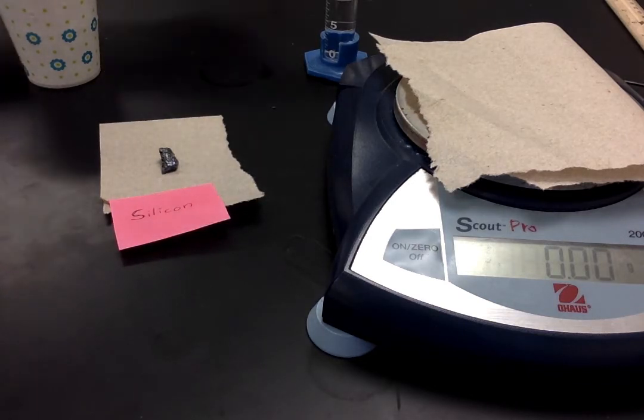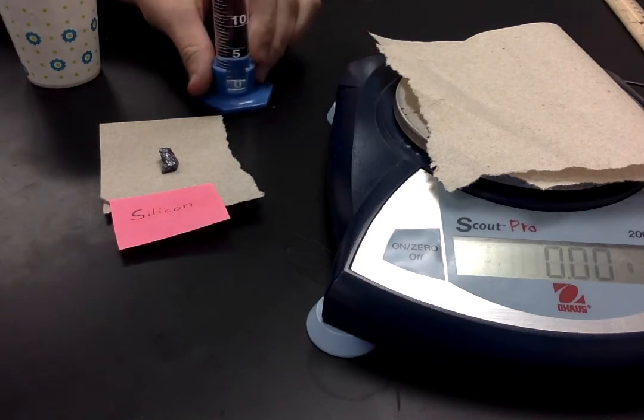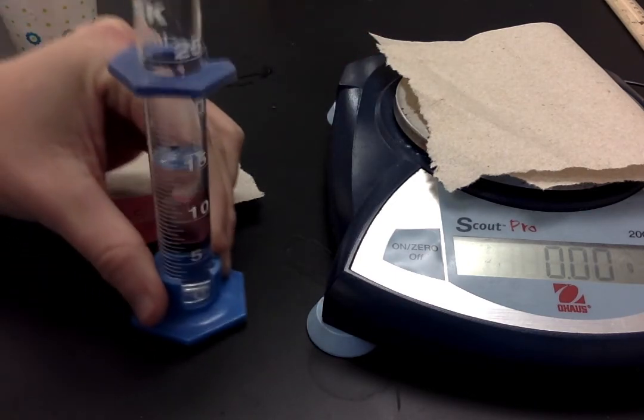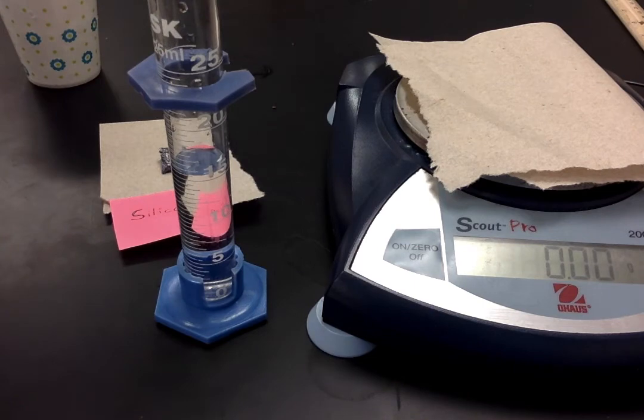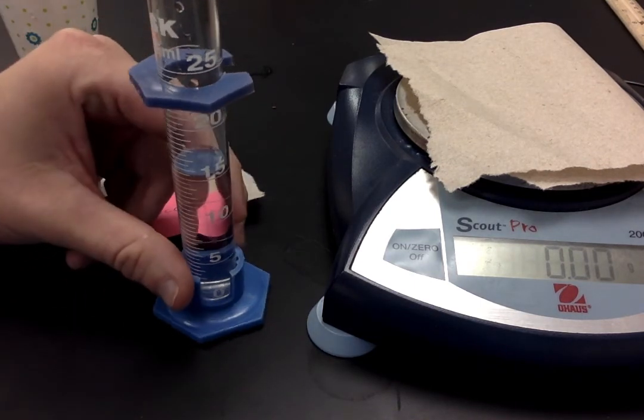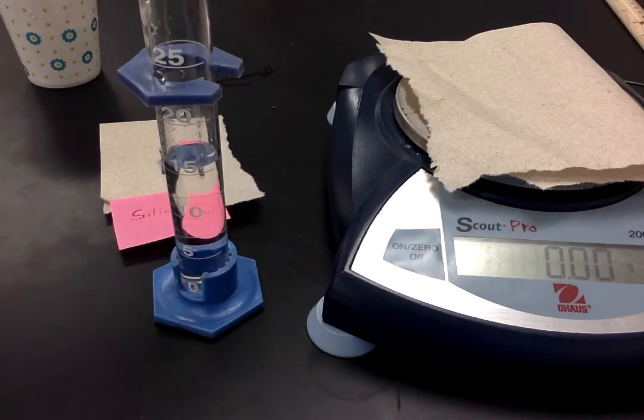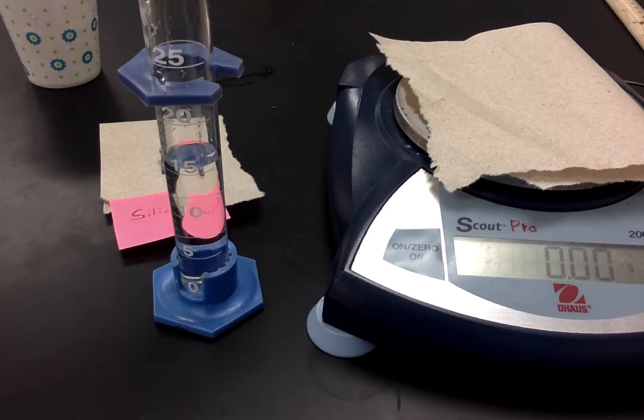Oh, you can't even see the graduated cylinder here. Let me get that in frame. So that's like right here. And it should be at about 15.9 milliliters. It's pretty close to 16, but I think it dips under a little bit. So we'll say 15.9 milliliters.